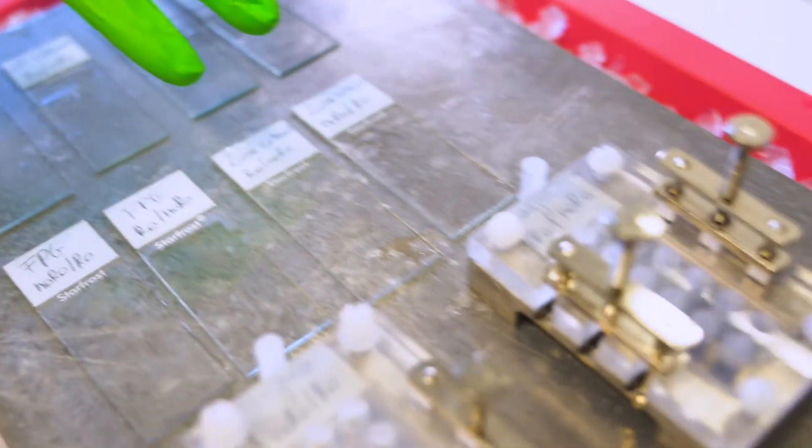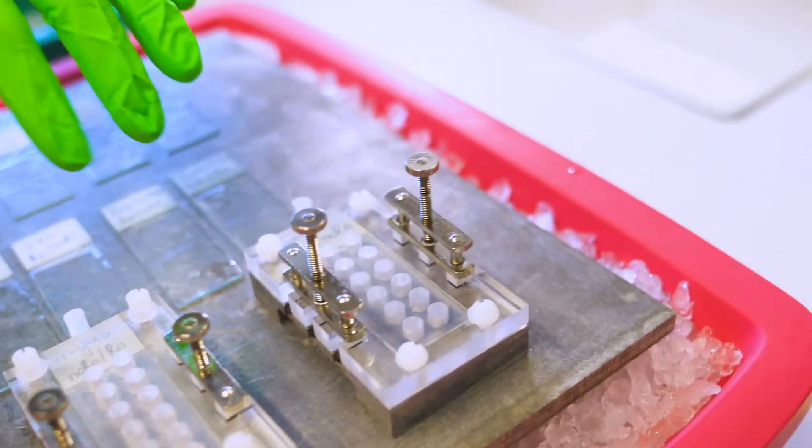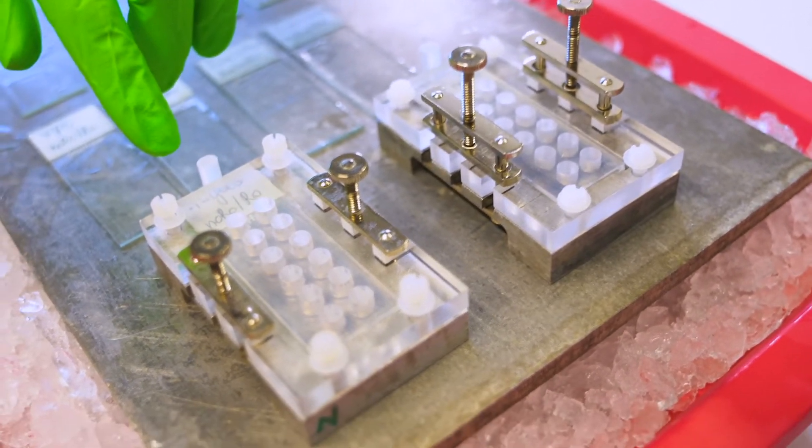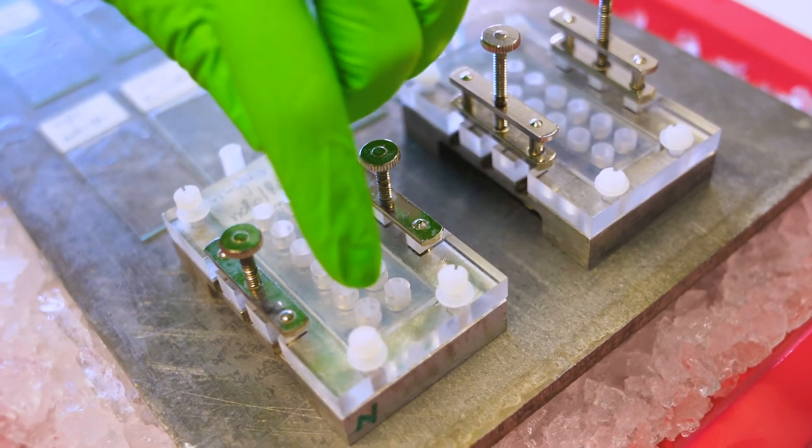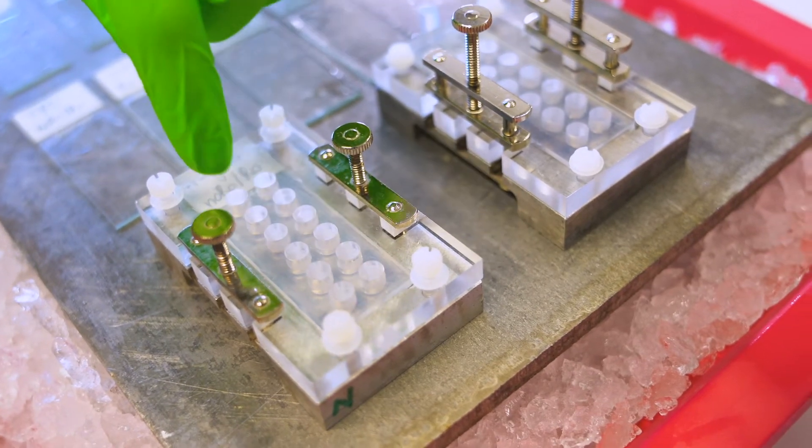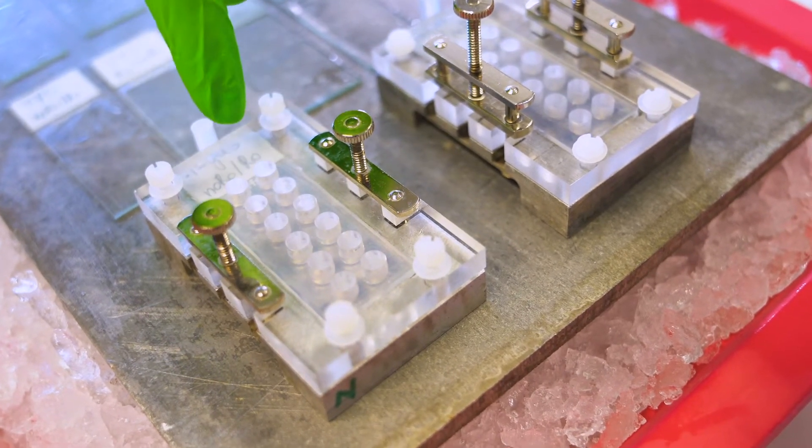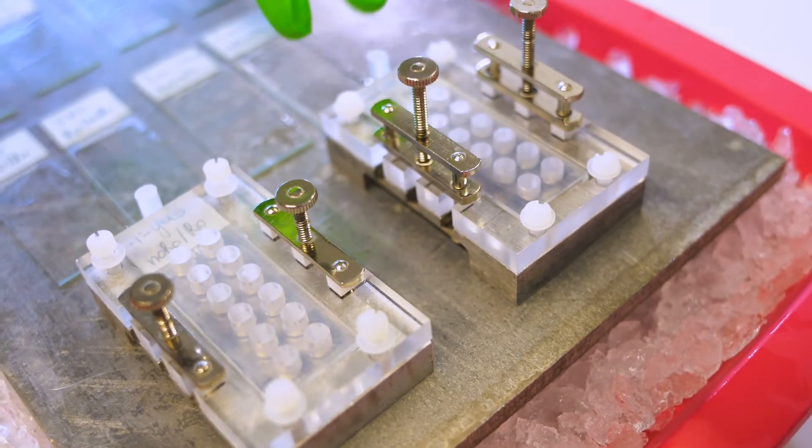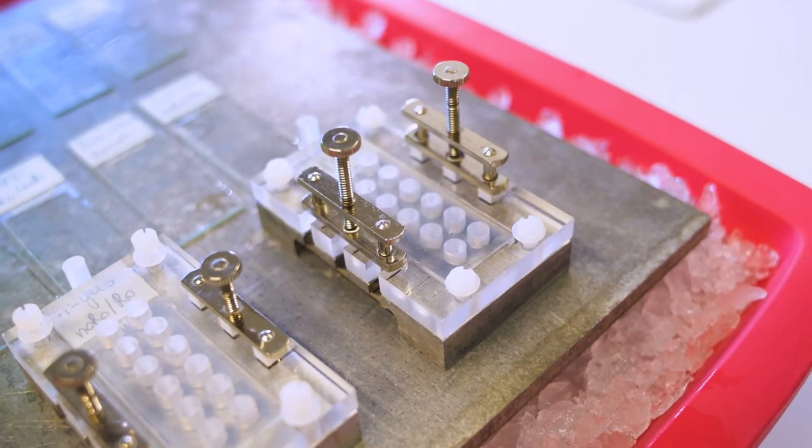Then these are the two gels per slide, but there's an alternative format which you can use which is the 12 gels per slide. Here we use the non-exposed cells as substrate cells on the bottom line and the compound-exposed cells on the top line, and you can do it again the other way around in the duplicate slide.